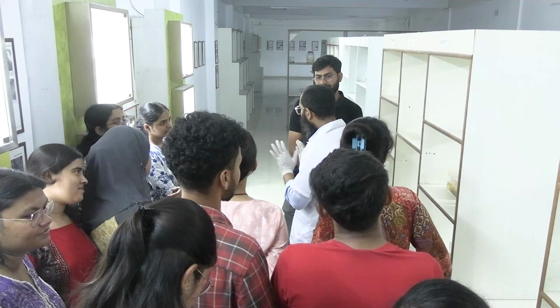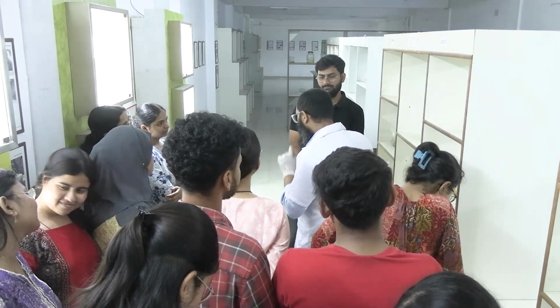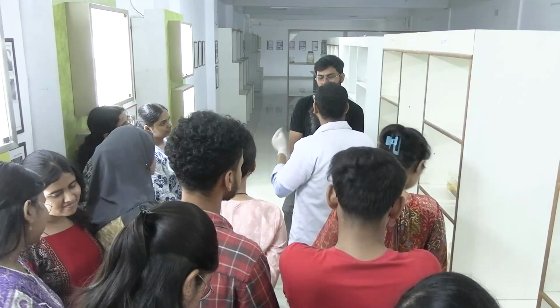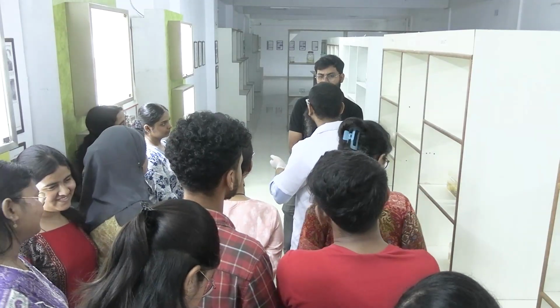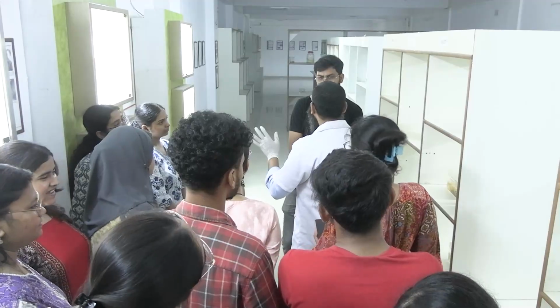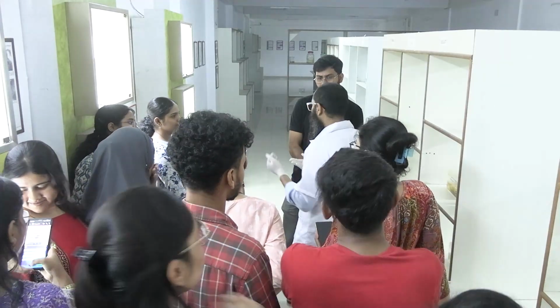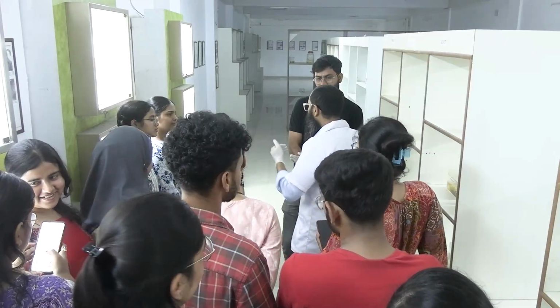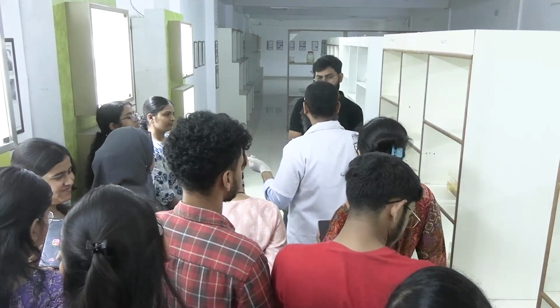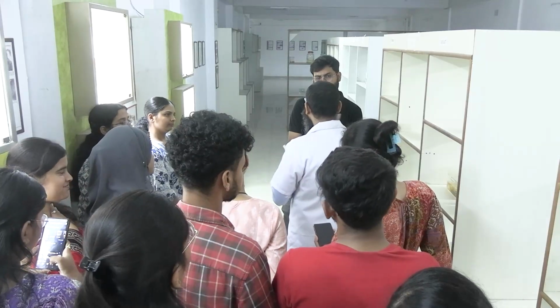The tissue starts autolyzing. Second point, there is also attack of bacteria and virus, because now there is no blood supply, no neutrophils, so there is no problem in attacking by those organisms. So there is a very high chance of getting autolyzed. All the details start degrading, nuclear details, cytoplasmic details.